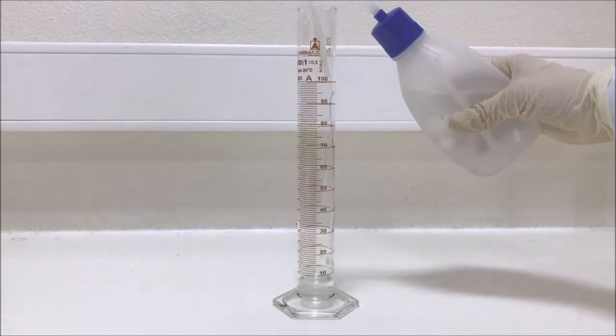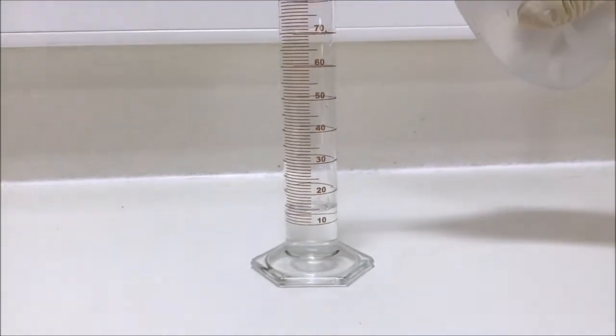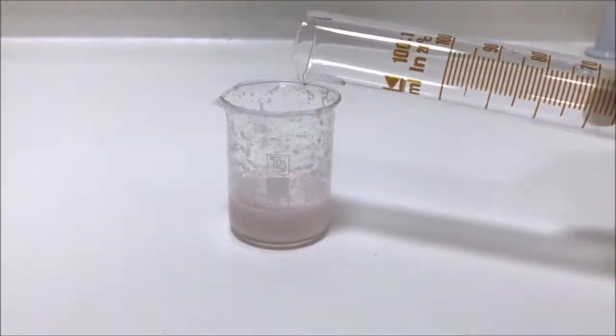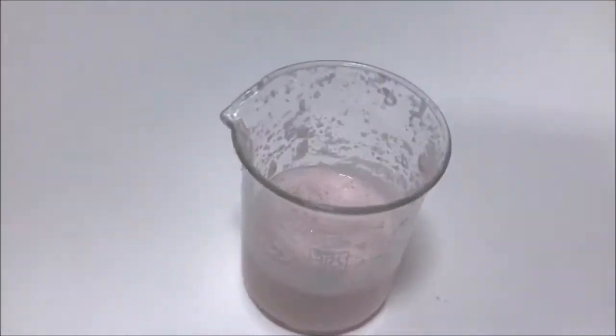Place 15 ml of distilled water into a 100 ml graduated cylinder and add it to the previous mixture, stirring with a stirring rod.